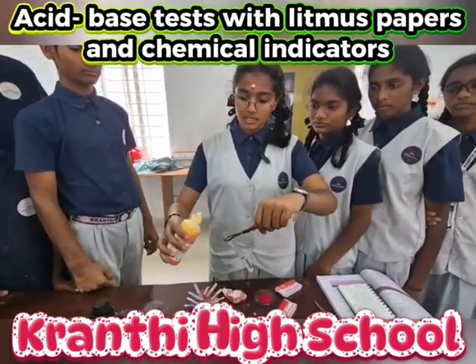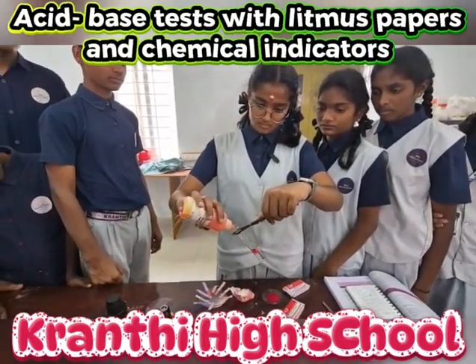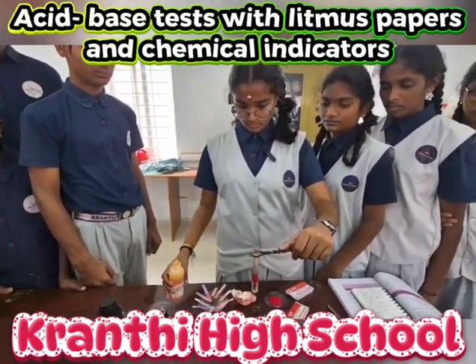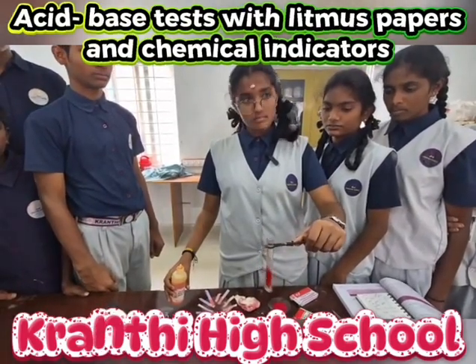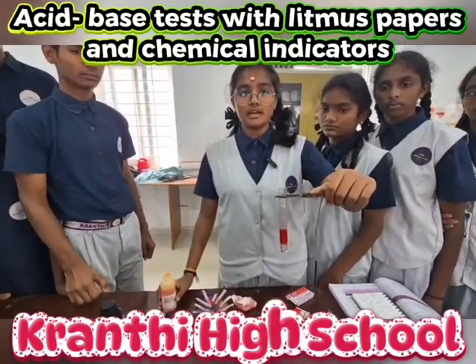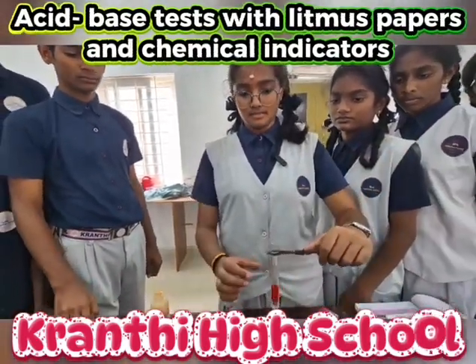Now we are adding methyl orange indicator. As you see that the nitric acid has turned into red color, so we can consider it as an acid.